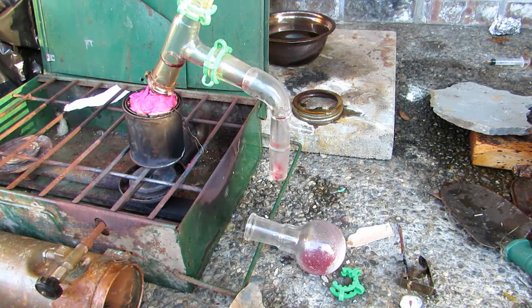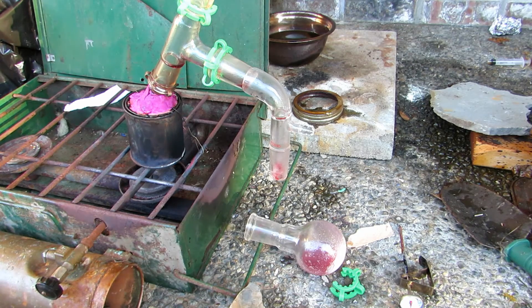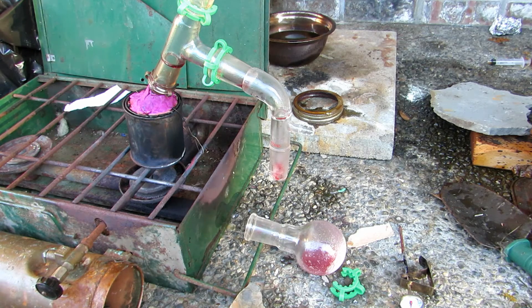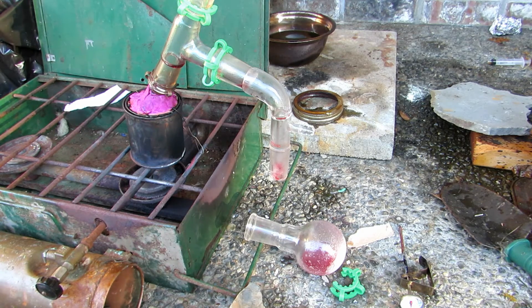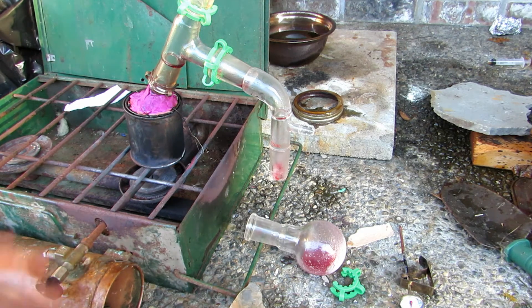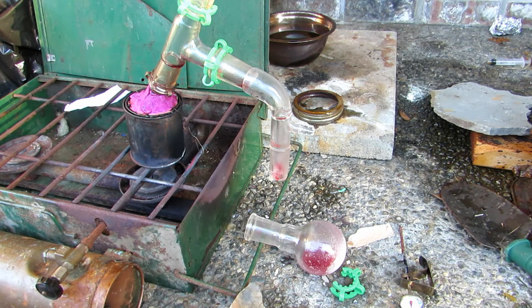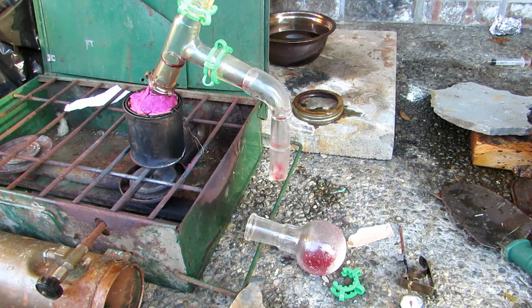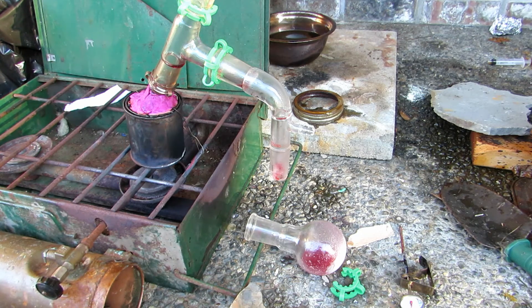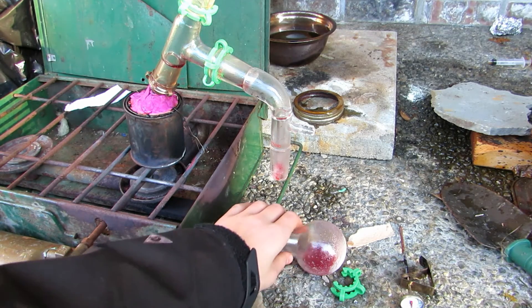We just finished and it only took about 10 minutes to get through everything, which was quite quick. You're probably wondering why it's all red — this is because I used Play-Doh as a sealer because I didn't add enough Teflon tape. Make sure you add a copious amount, because I had a couple of air gaps and the phenol vapors were escaping. I added some Play-Doh, but then red things started to come over because of the dye in the Play-Doh, and the smell from the Play-Doh was distilling over as well. If you are going to use Play-Doh, use white Play-Doh so you don't contaminate your product with dye. But we're going to be doing another distillation anyway, so it doesn't really matter.